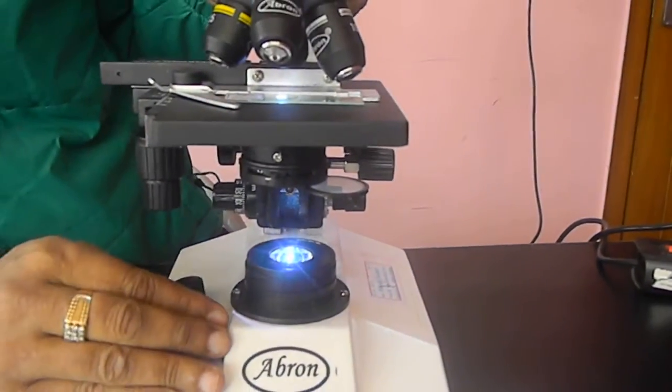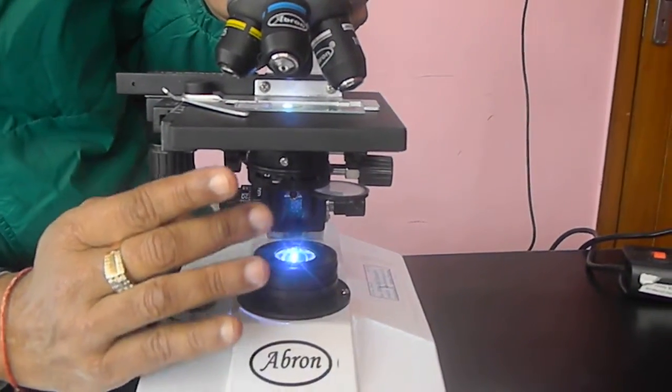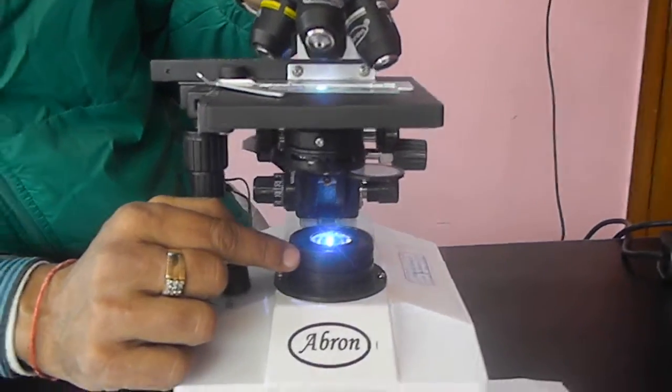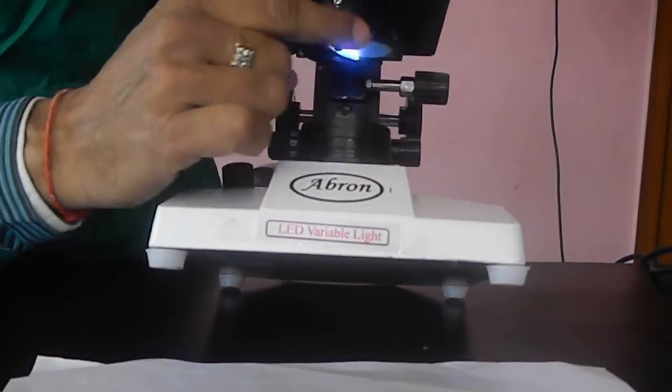In the halogen system, this filter is better because it gives you white light. But in LED, which is white light, you do not need this filter.